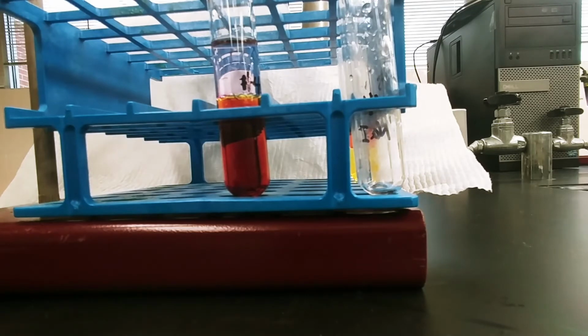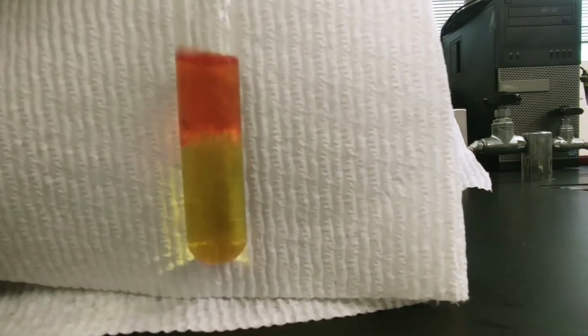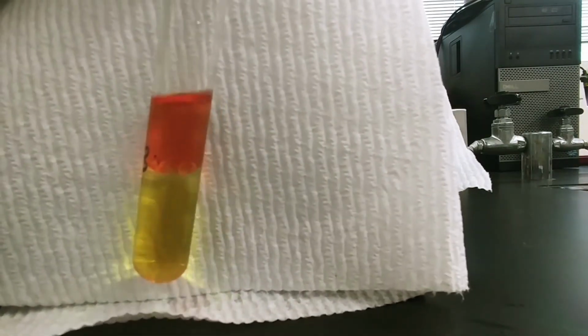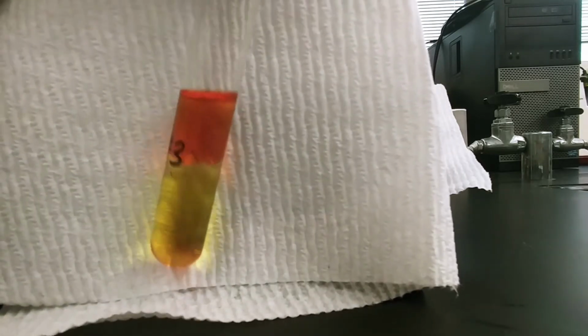So based off of the color, after we mix this really well, based off of the color of our cyclohexane, we'll be able to tell what halogen is present. And based off of what halogen is present, we'll be able to know if a reaction is taking place. Again, remember, the top layer is your cyclohexane layer. This is the sodium bromide with the chlorine added to it. The cyclohexane is pulling whatever halogen is present in this test tube up into it.